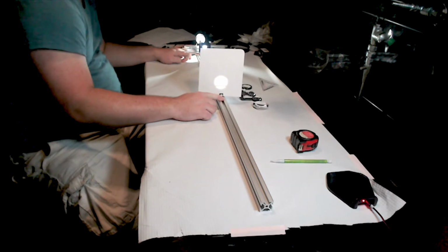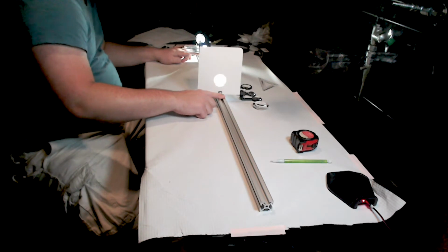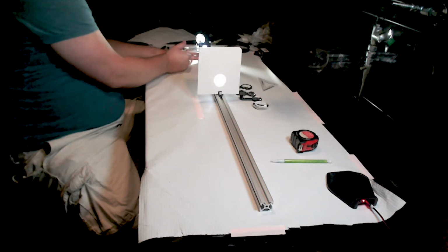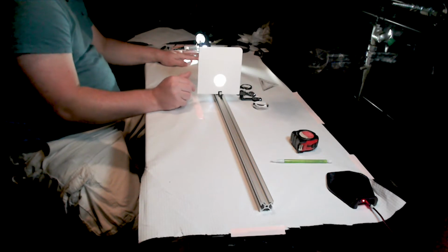Aha, so what we have arrived at is pretty close to the image plane of our one lens microscope here. And you can see that we have formed something of an image of the ruler on here.